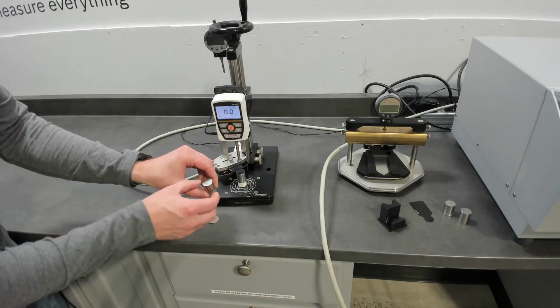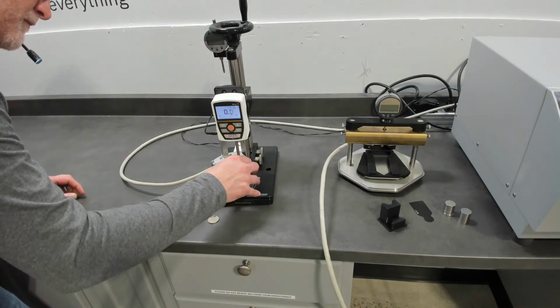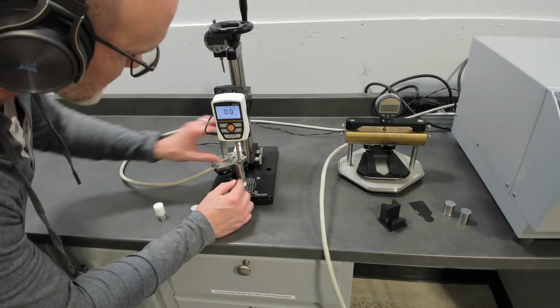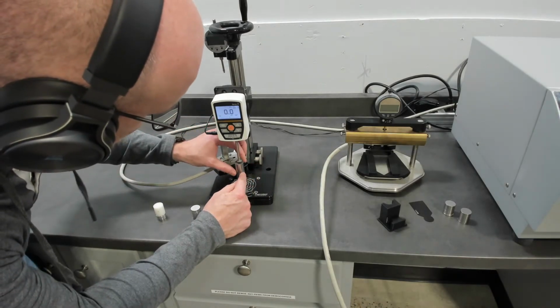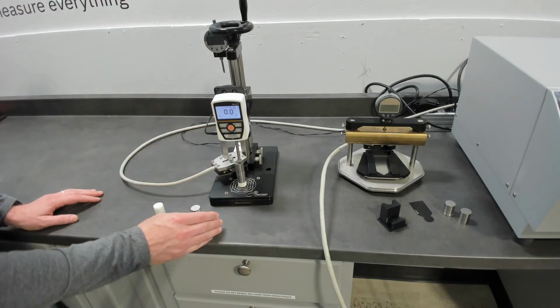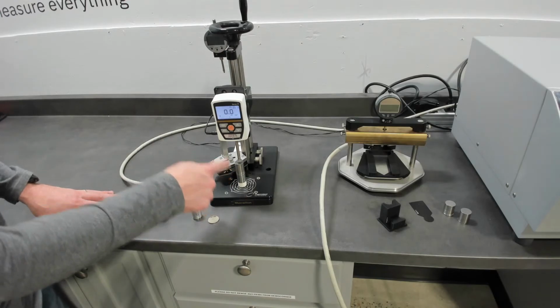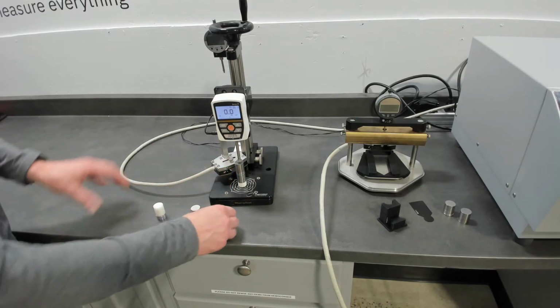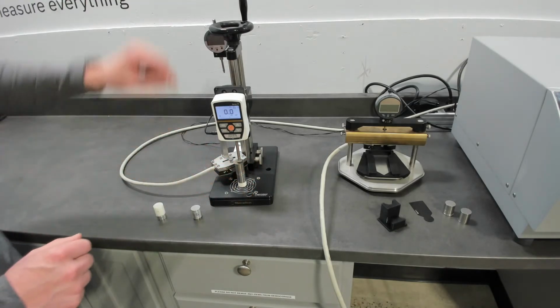And this is stainless steel. I'm trying to not put my hands in the way, but it's hard to do. We're going to make sure those are well aligned with the sensor. The sensor is almost identical to the same diameter of our one-dimensional shapes, so that does make it somewhat easier to set up, because you would see any exposed sensor.